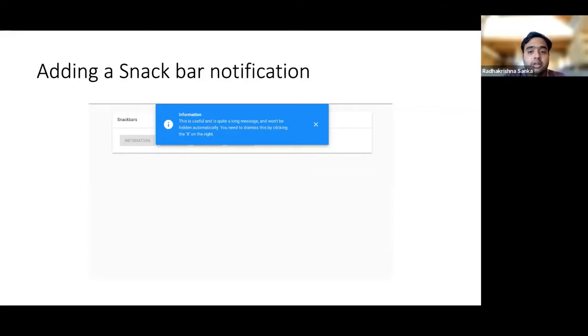So in this particular programming task 2, I'll be adding a new snack bar notification onto the design tool. What we'll do is every time the user clicks the save button, it will show a pop-up saying that, oh, downloading files now. And that's the snack bar we'll try to do. A snack bar is essentially a small window that pops up either in the bottom or the top of the screen, or maybe in the middle, based on what tool you're using, and it has some information inside it. So I'm going to stop sharing over here, and I'm going to start sharing my desktop soon.